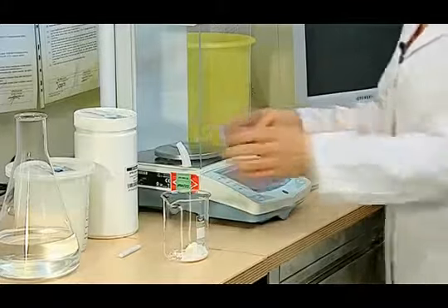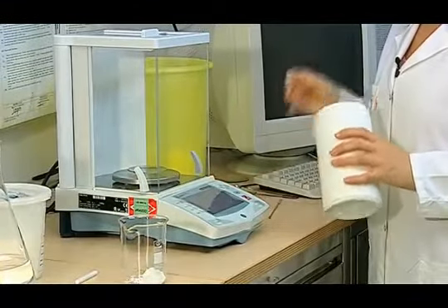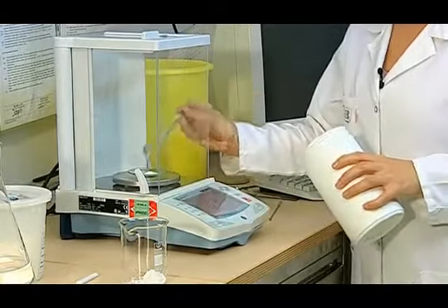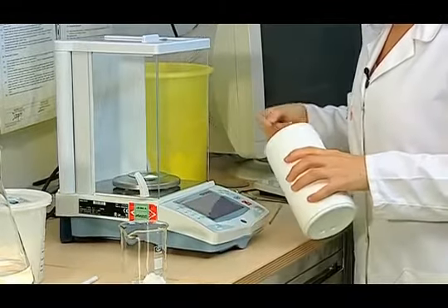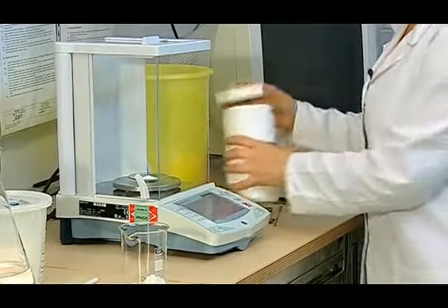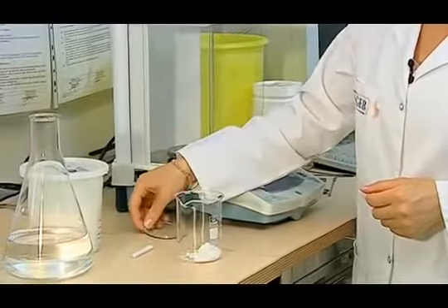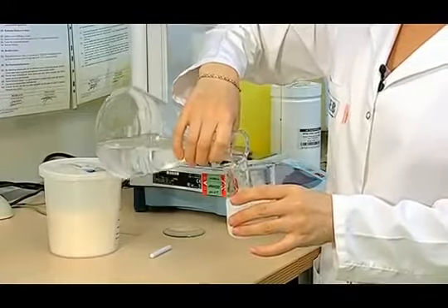Then, the 20% portion of sodium perborate detergent, which is 2.36 grams, is weighed with scales. This weighed detergent, 2.36 grams, is added to the ECE detergent, 9.09 grams.